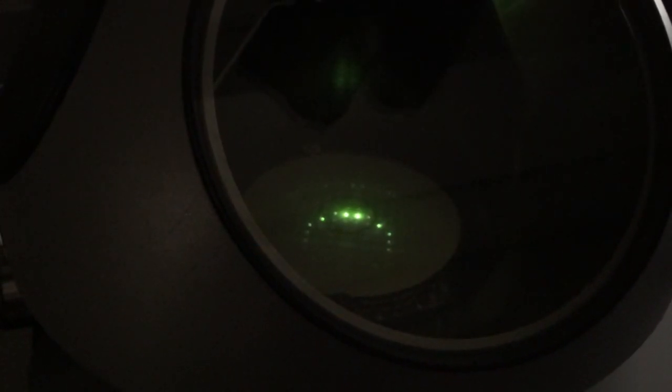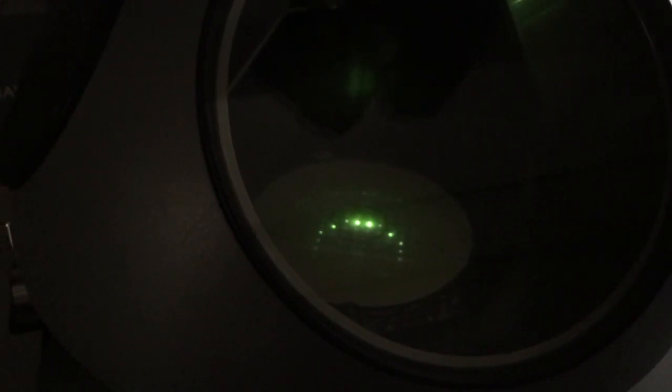In other words, that Bragg spot to the left of the direct spot that is dim right now. Or conversely, if it helps you, you could think of it as moving the Bragg spot to where the direct spot currently is. So I'm going to come back, hit my dark field button. Now again my multifunction knobs control beam tilt. So I'm tilting the beam here.